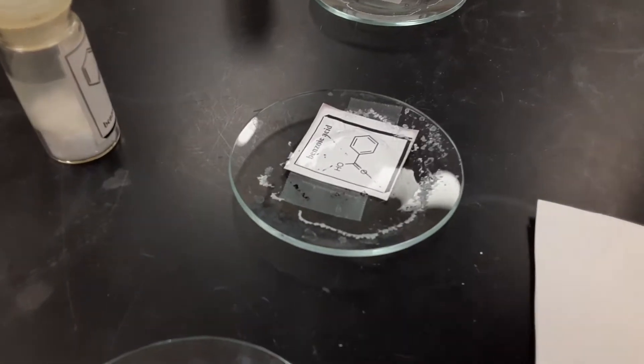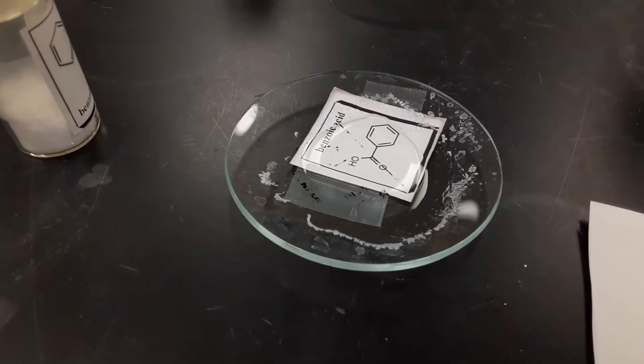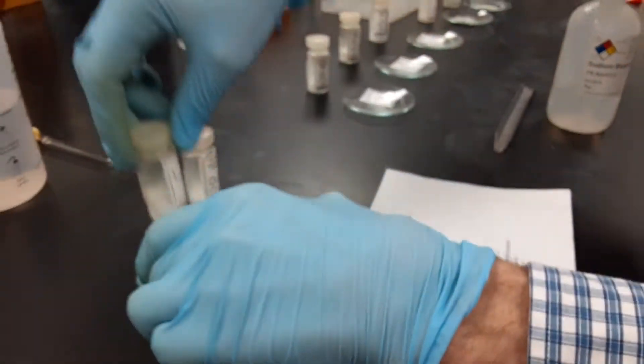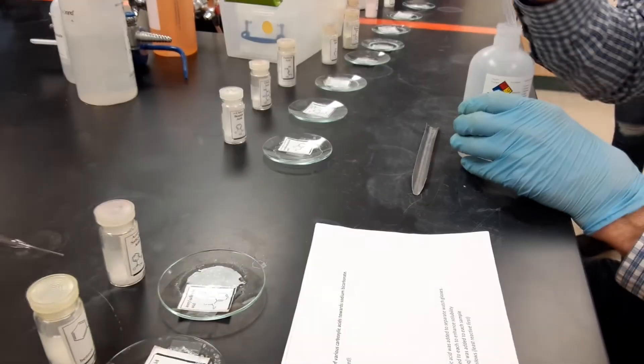And I have to say that's slower, isn't it? So in order so far, that's slow, a little faster. Moving on to orthochlorobenzoic acid.